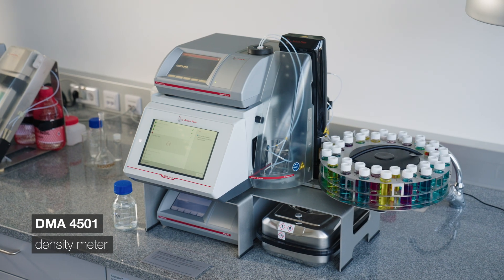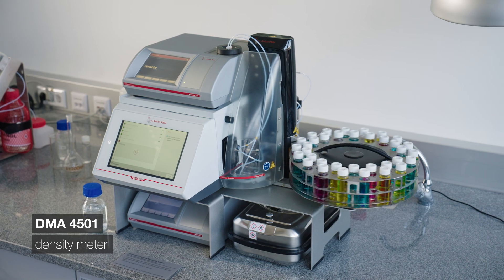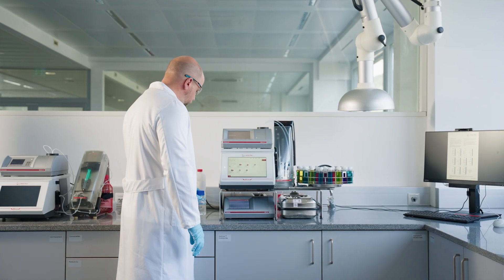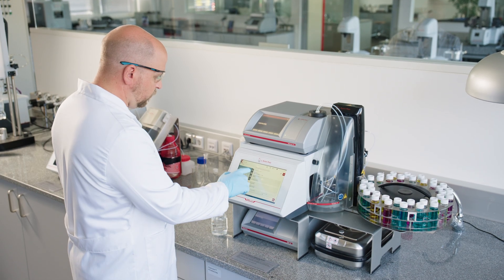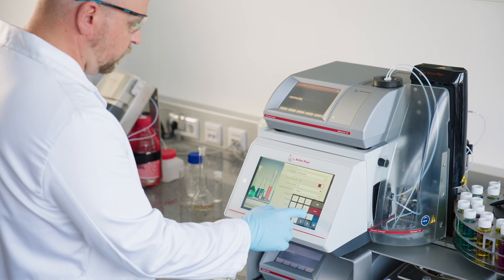Ideally, a fully automated instrument equipped with an autosampler and monitoring multiple parameters simultaneously, such as pH, viscosity, and refractive index if needed, would be the go-to system for quality control during electrolyte R&D and QC. In this example, using an autosampler to handle a larger number of samples, we are measuring the density of a dimethyl carbonate-based electrolyte solution.